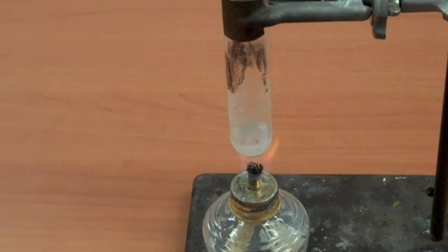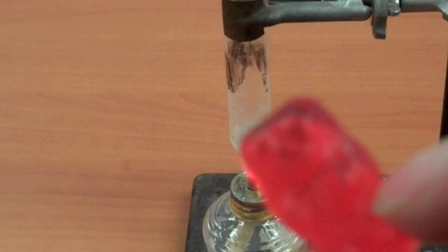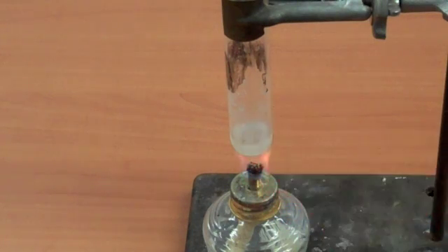That might sound similar to sodium chloride. It's similar, but it's got oxygens attached. When heated, sodium chlorate decomposes, and that allows a sufficient amount of oxygen to be in there to react with sugars. I have a gummy bear here, and Mr. Gummy Bear is very high in sugar.